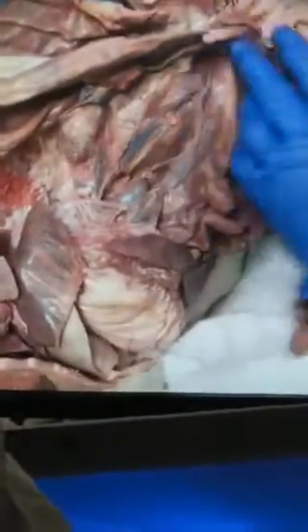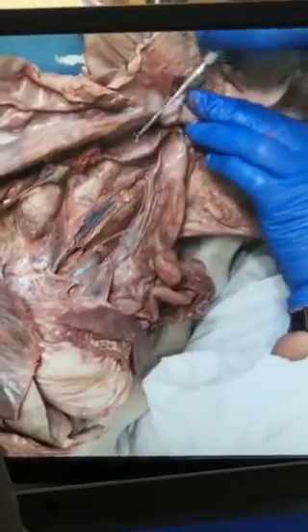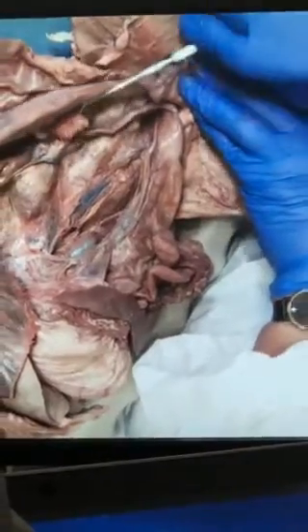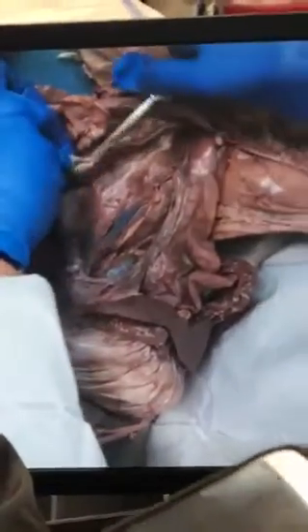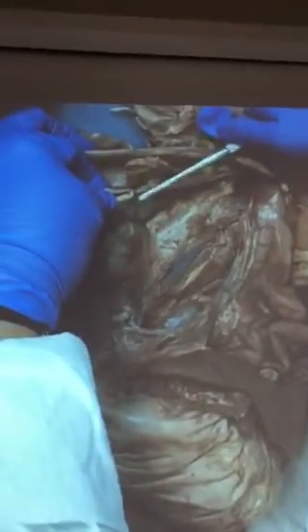And then, of course, this is the urinary bladder, so this is a female. This is the uterus. At the end of the uterus is the ovary — this is the ovary here. And of course you have the vessels branching from it: the ovarian vein and ovarian artery.